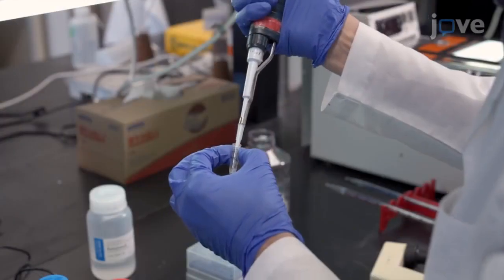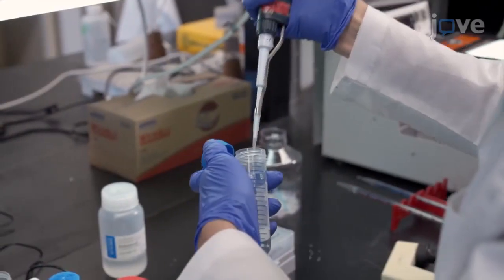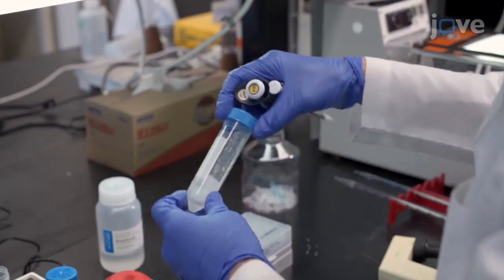Then dilute the primary antibody with 10% IRE-1, mixing it gently and thoroughly.